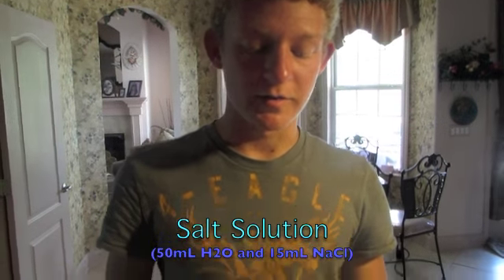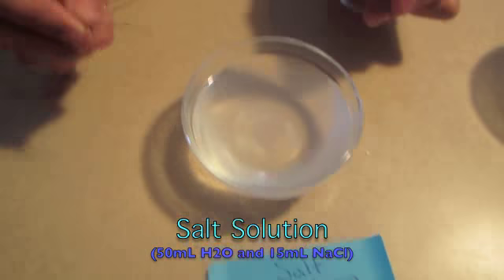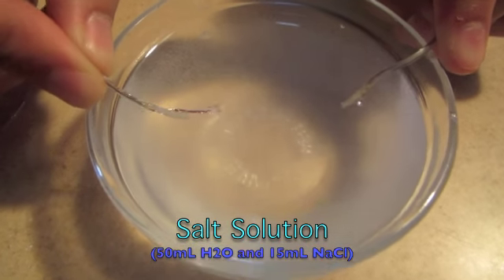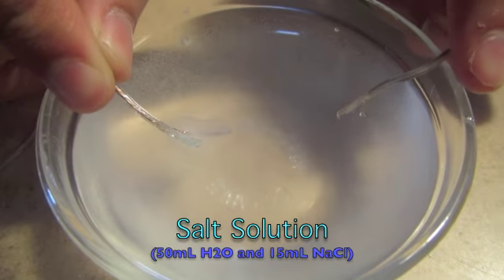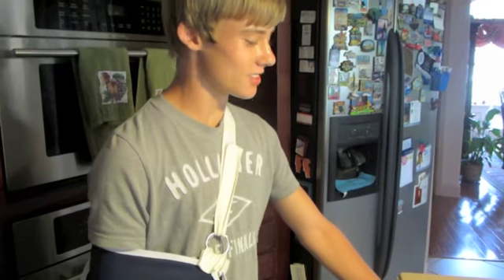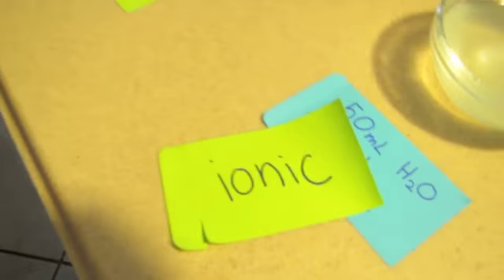This one right here is the salt solution, which, as you should know, is also an ionic solution. So as you see, when I put this in here, it's going to make huge amounts of bubbles on both wires. And this is because the ions in the solution are helping the electricity to travel much more easily. The salt solution made even more bubbles, so it's ionic.